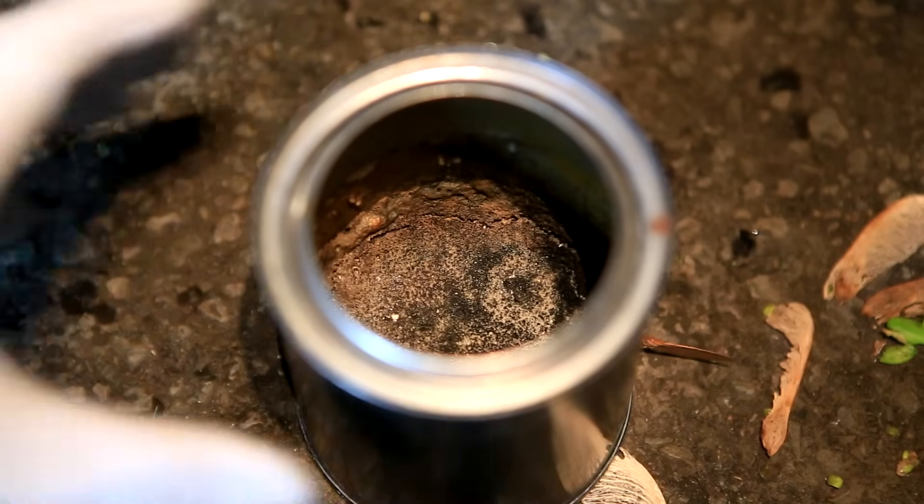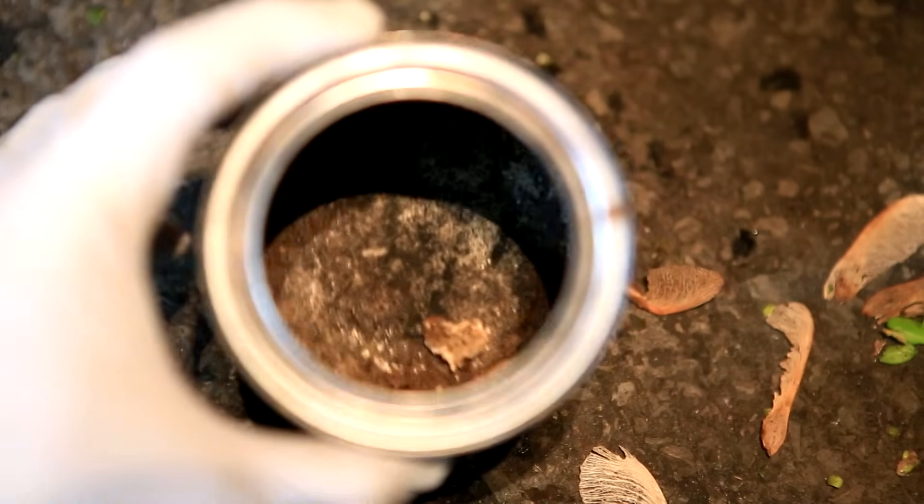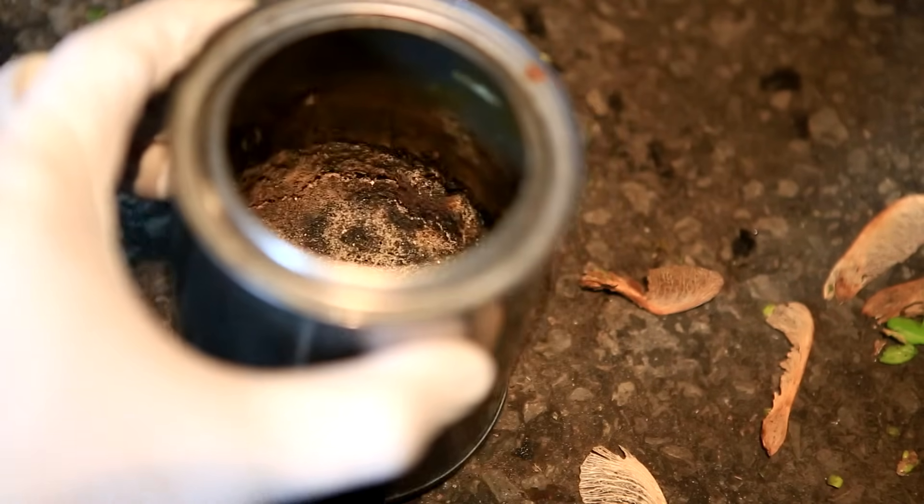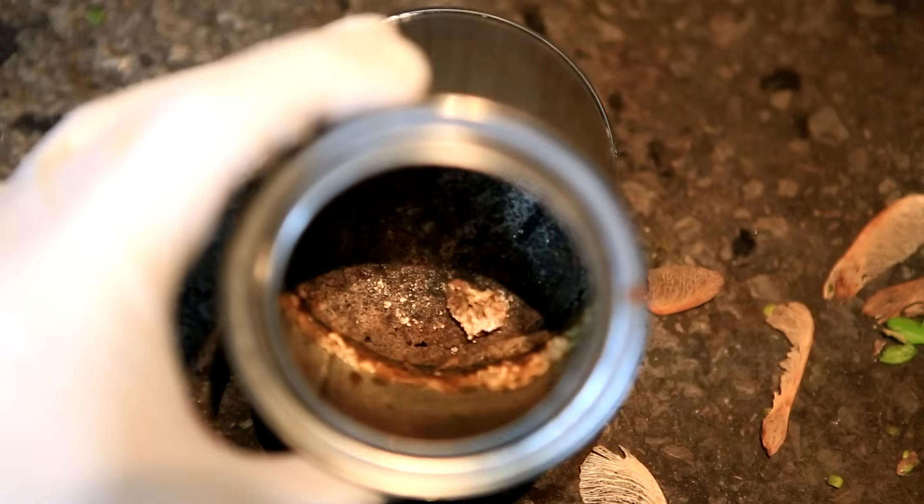At the bottom of the can I was left with some very hard black salt crust. With some effort the can can be cleaned out and reused for more distillations.